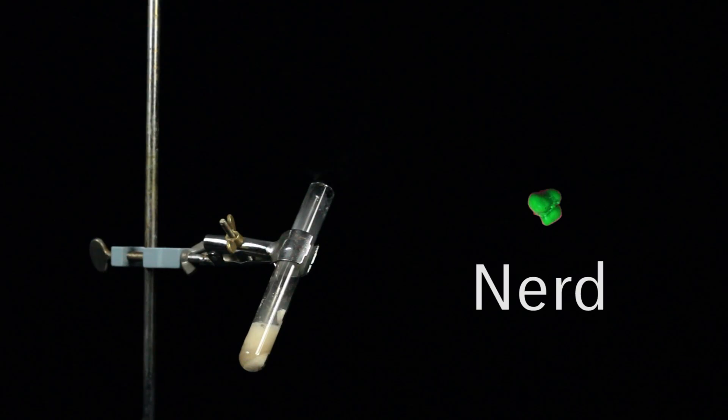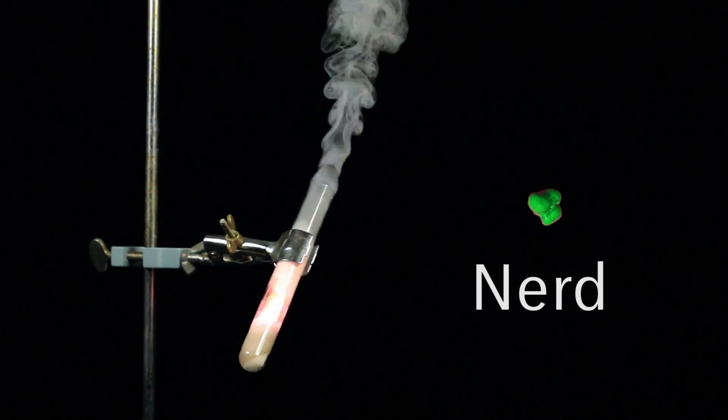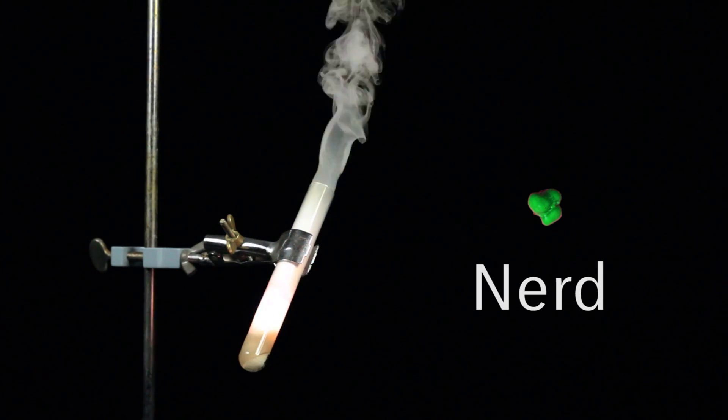Now it's time to decide what type of candy you want to use and drop it in. The oxygen from the potassium chlorate will react with the carbons and hydrogens from the sugar, releasing the energy held within.